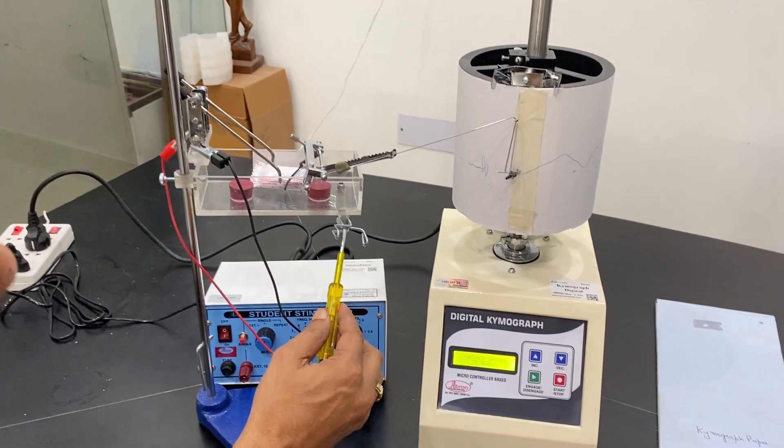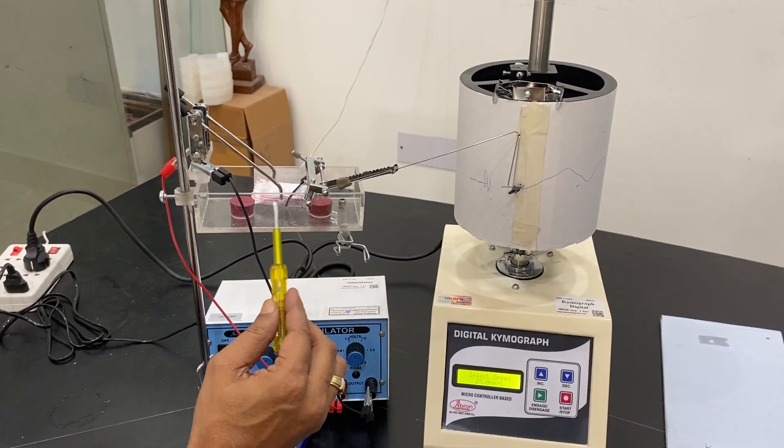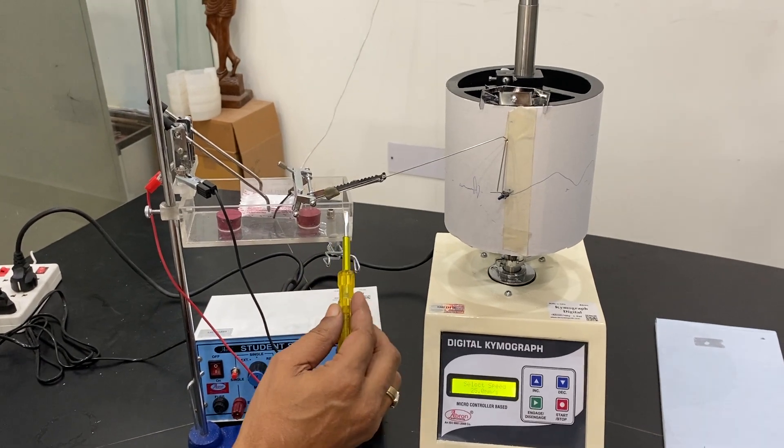It has water outlet. You can put the water inside, saline water, where the heart will keep alive.